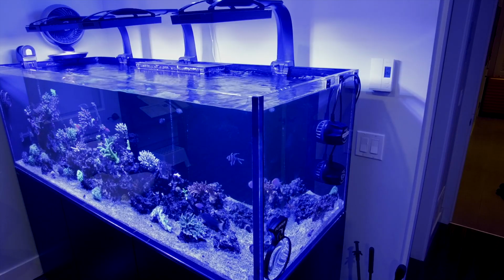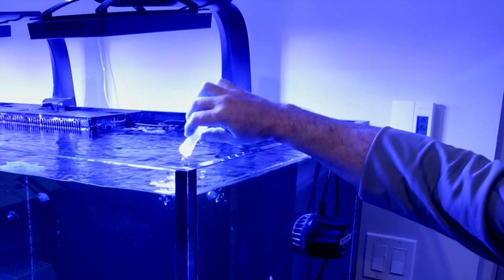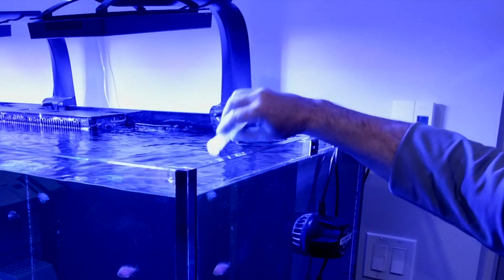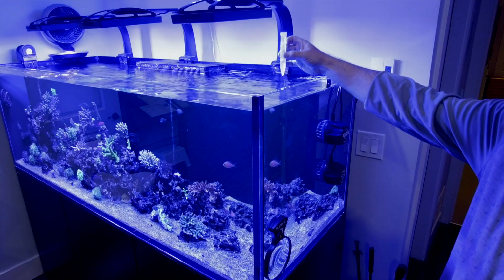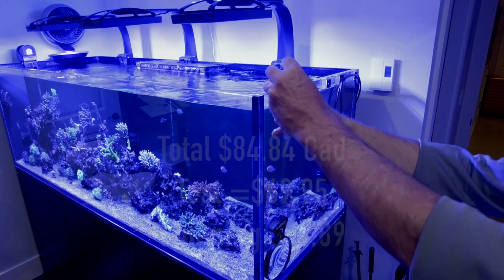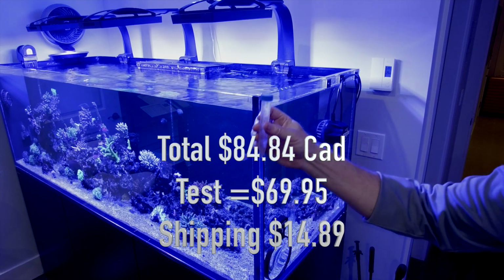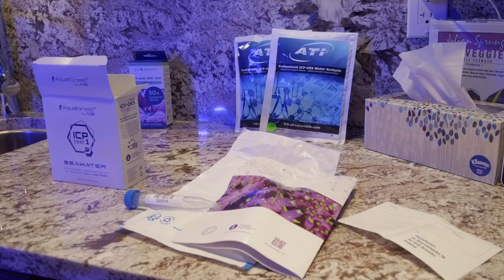Alright, so it's first thing in the morning. We're going to rinse this tube out. We're in a nice high flow area of the tank. We'll collect our sample here, seal it up, and get that ready to go. Okay, we've got our water sample.